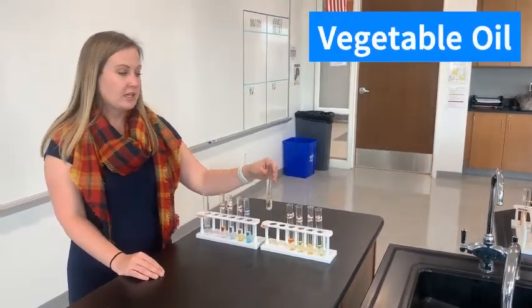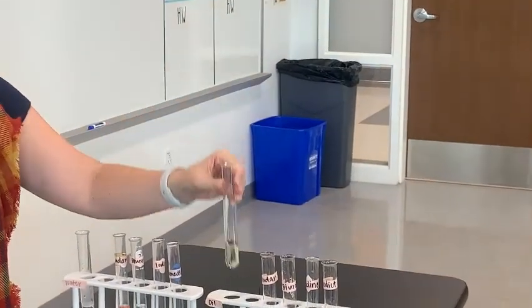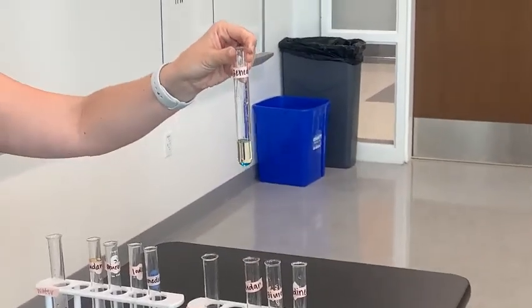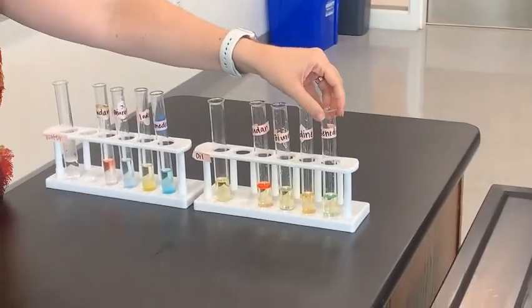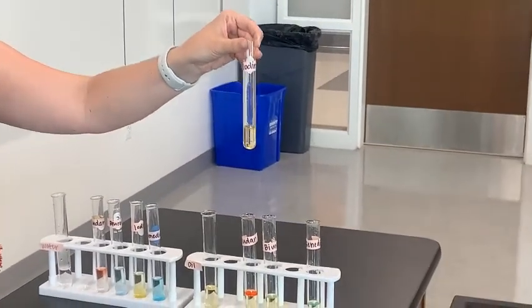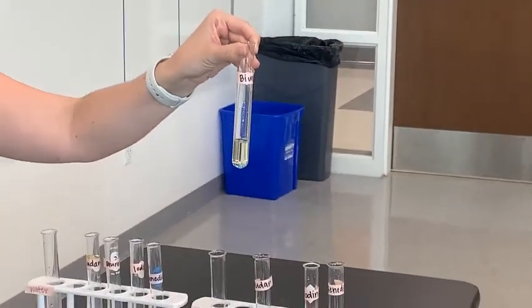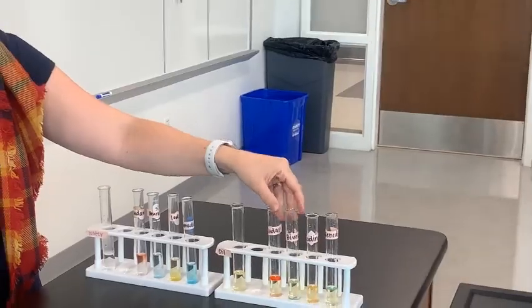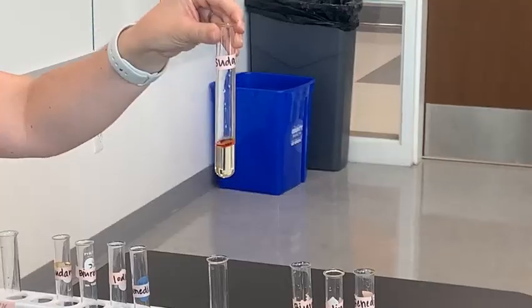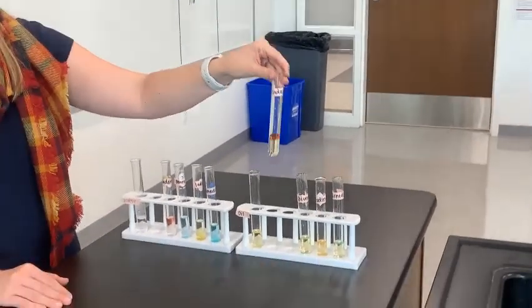Oil was another one of our knowns — just normal cooking oil, kind of a pale yellow. When added with Benedict's solution, it's still blue. With iodine, it's still that yellow-brown color. With the Biuret solution, still that light blue, no color change. But we do see a change with the Sudan solution — a very bright red ring at the top, so we did have a change with Sudan.